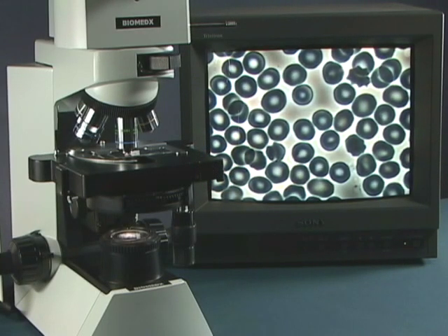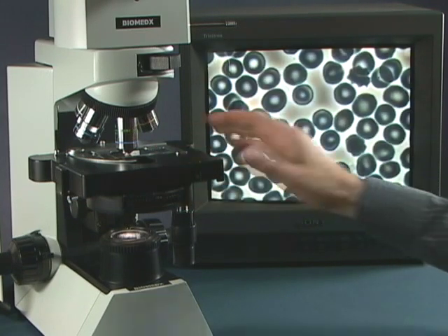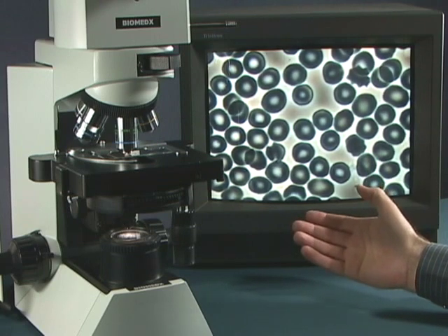So that's three methods to actually center your phase annulus with your phase ring and the objective above so you have a high quality phase contrast image.